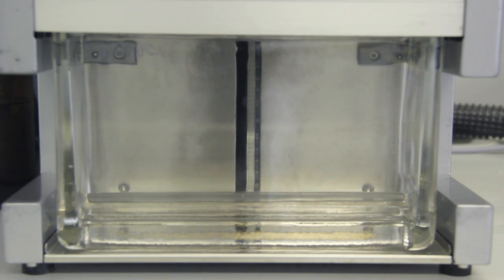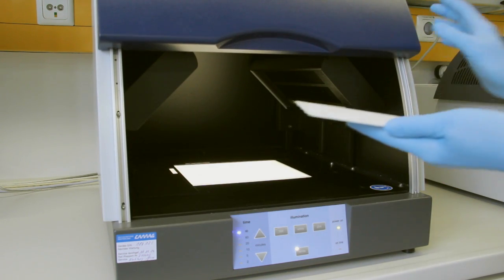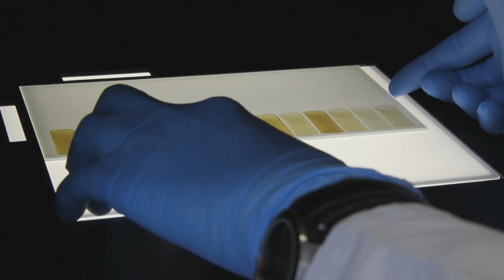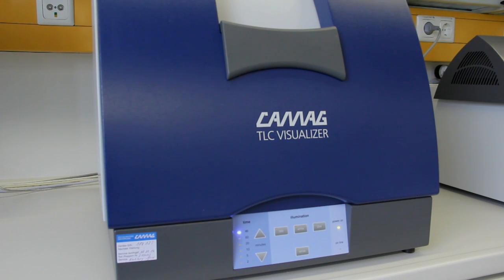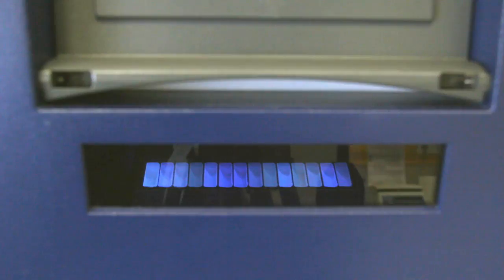Using a TLC Visualizer, documentation of the chromatogram at UV254, UV366 and under white light illumination followed. The analytes were front eluted and separated, but not yet visible. However, the beer sample matrix was clearly visible due to its brown color, which remained distributed over the starting rectangle or because of its blue fluorescence at UV366 nm.